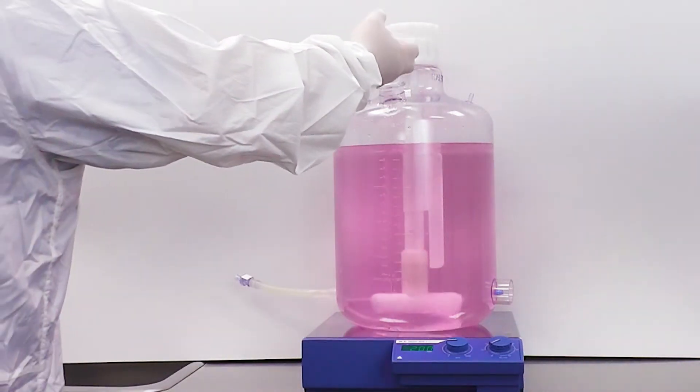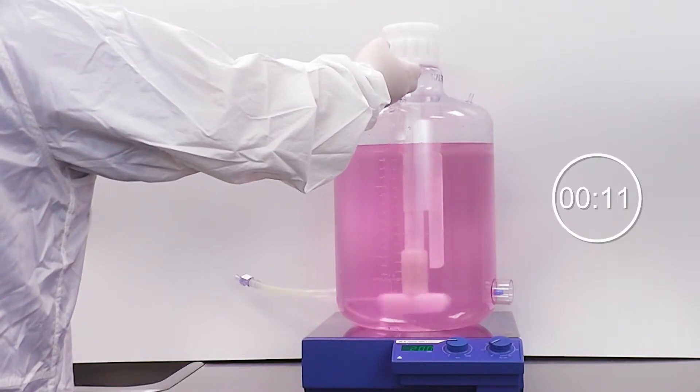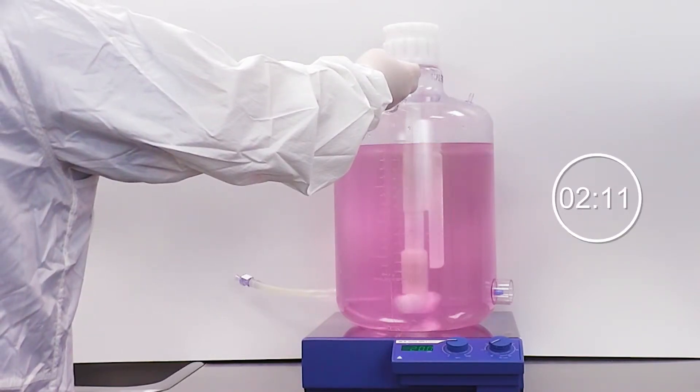After the base has been added and the liquid is fully pink, we add the acid and time the shift.